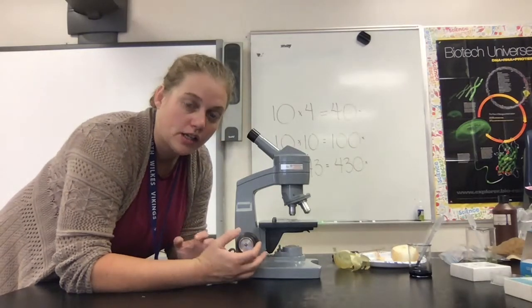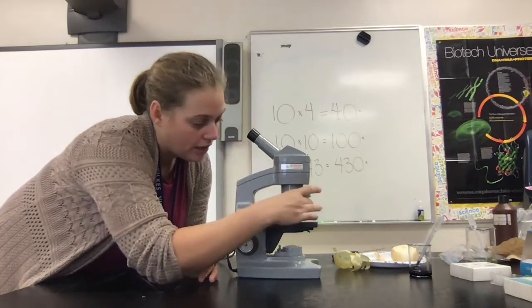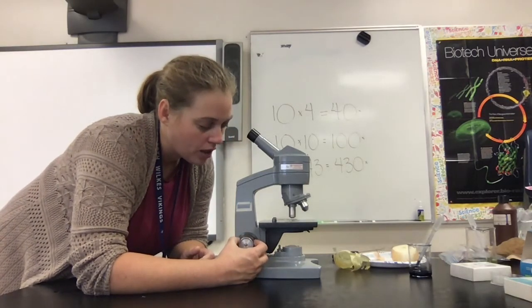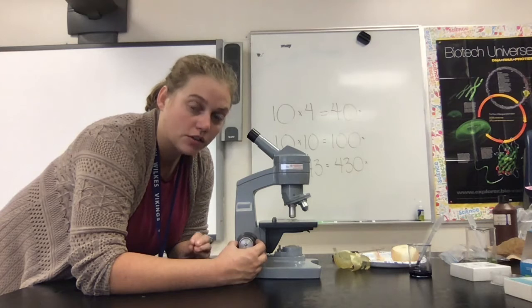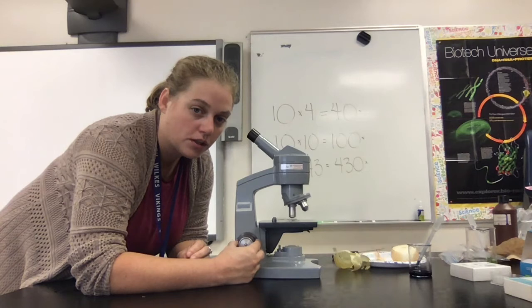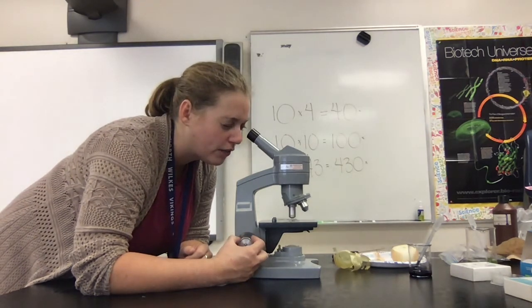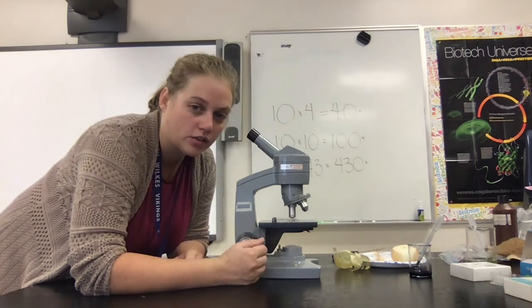Once you have detail set on that power, center your specimen in your field of vision, then switch over to the next highest power. Once you're in high power, make sure that you're only using the fine focus knob. Anything else is going to move the objective too quickly, and in certain microscopes you could damage the lens because the coarse knob can move the entire objective and you might end up breaking the slide. On high power, use only the fine focus to toggle back and forth to see detail and different layers of the specimen.